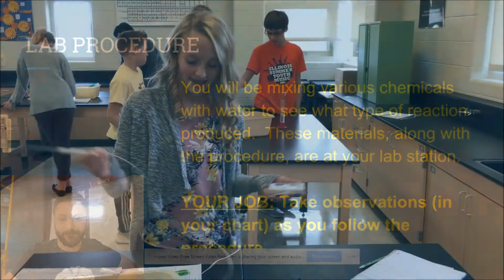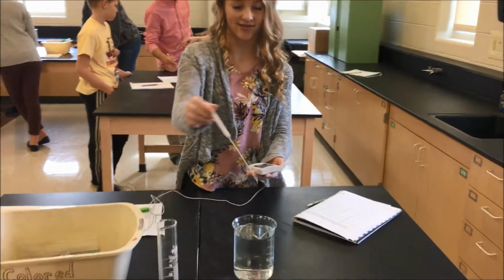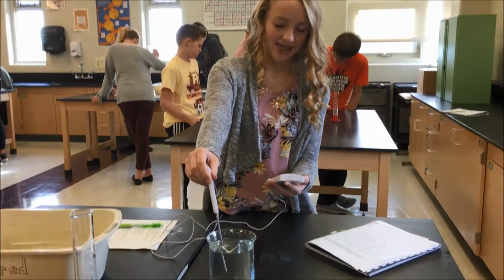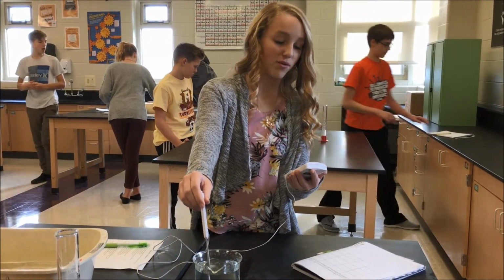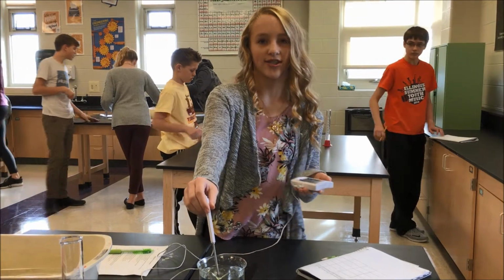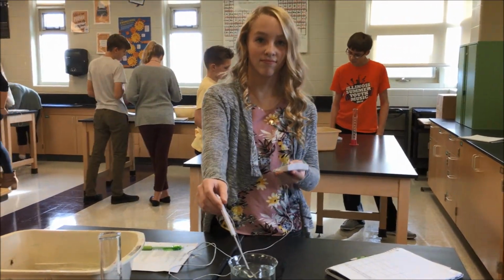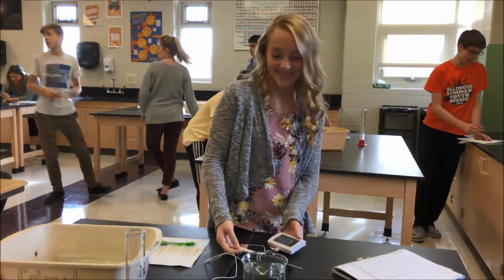First thing I'm going to do is take the baseline temperature of this tap water. Stick it in. And in Celsius, it's 23.7 degrees Celsius. Great. So if they are taking notes at home, they should write that in their chart right now. Yeah. Great. All right, everybody, write it in your chart.